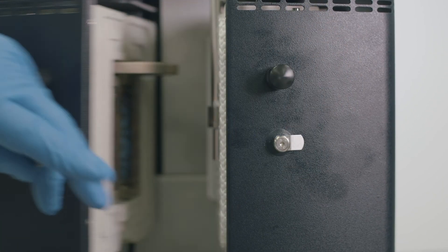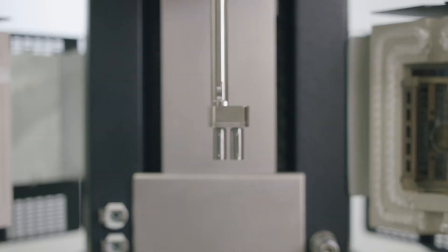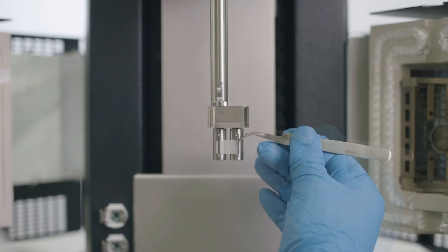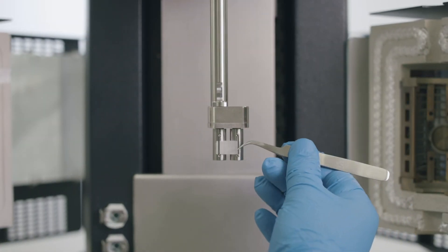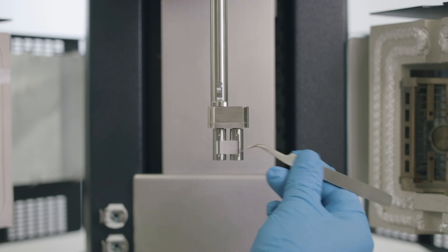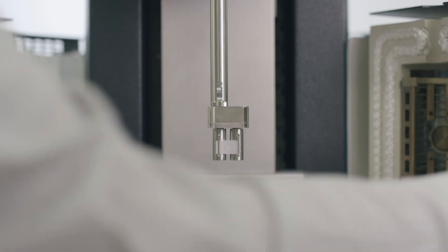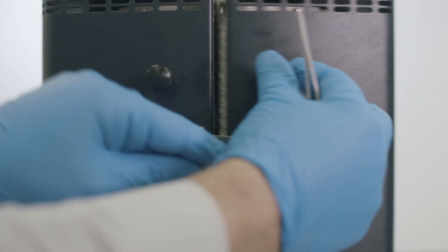Load the sample quickly in the case that the sample has a low melt viscosity at the desired test temperature. Thread the sample through the loose clips and close the clips just enough to touch the sample. Do not compress the sample. Close the oven and begin the test immediately.